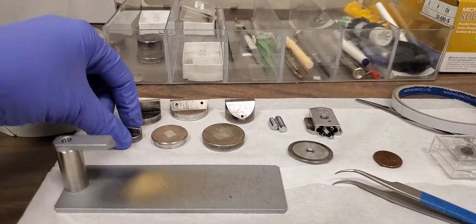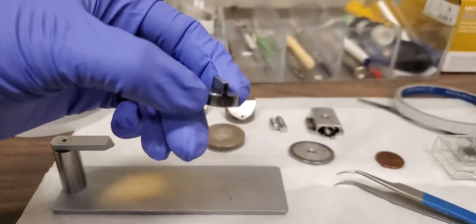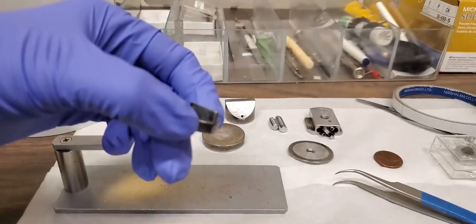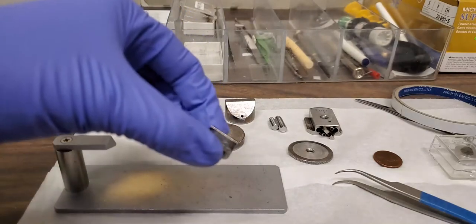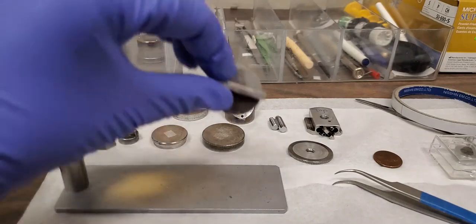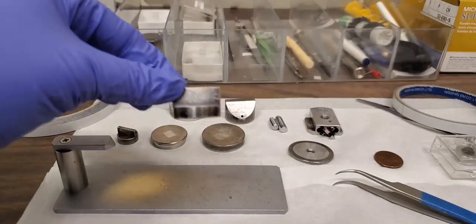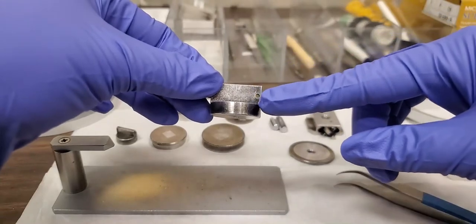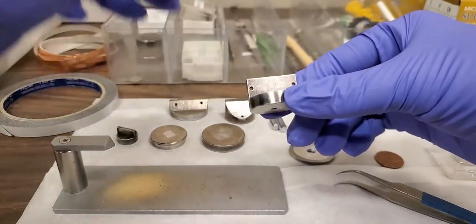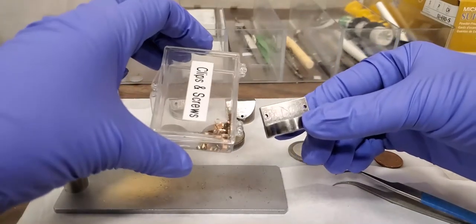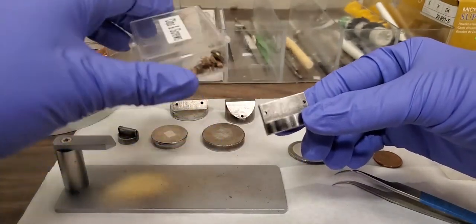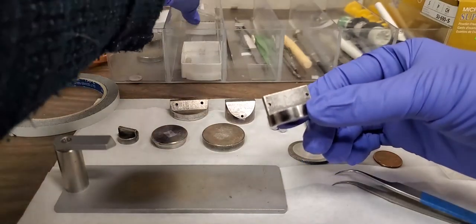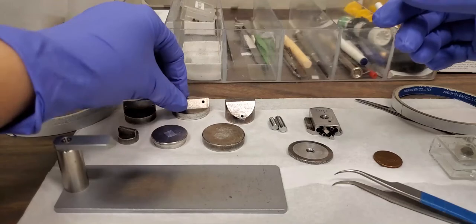You can see this one has a wall. You could mount your sample to look at a cross-section, but it's for very small samples. You could use this one for larger sample cross-sections. It also has these holes here, and the holes are for if you're not going to use carbon tape you can use clips and screws to clamp your sample to it. And this also works for this holder.